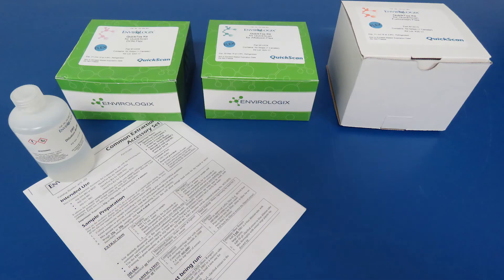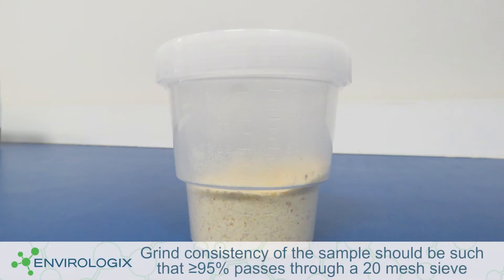Allow your common extraction accessory kit and FLEX mycotoxin test kits to come to room temperature. For the purposes of this video, we are running the common extraction protocol for all three FLEX assays using a 25-gram sample of ground corn.